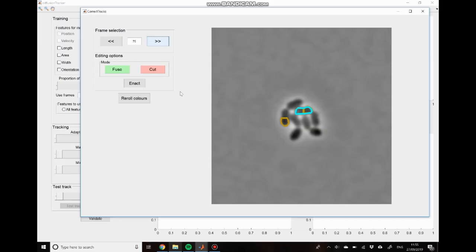Okay, so I've finished the fusion correction part of the process. So that means that we've completed this mode. We're now going to move over to the cut mode. And just to motivate why we have to have this mode, this is an example of a tracking event that cannot be corrected using the fusion module alone. So you can see there's this object that looks remarkably like a cell just after the division that appears suddenly, but there's no corresponding sister cell over here. There's also no corresponding mother cell in the previous time point.